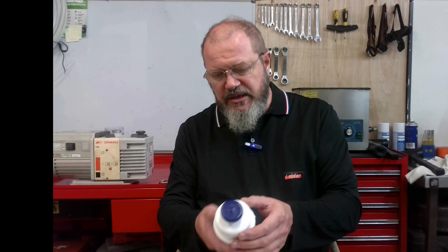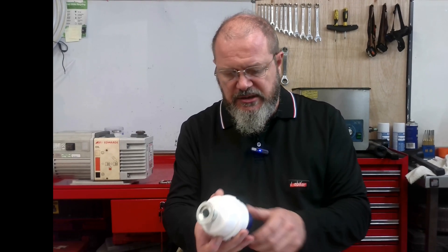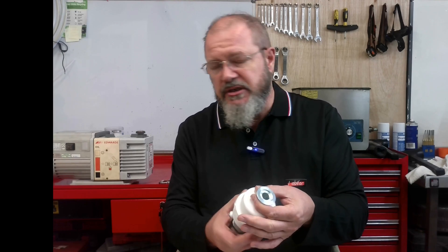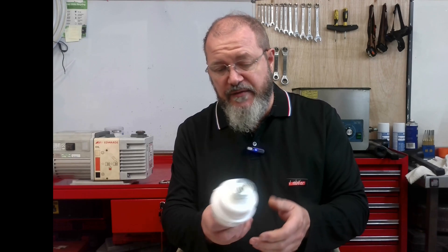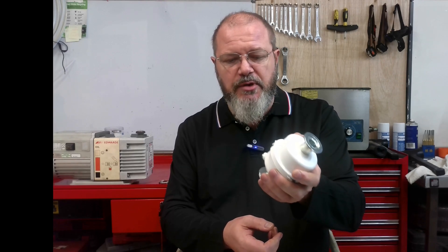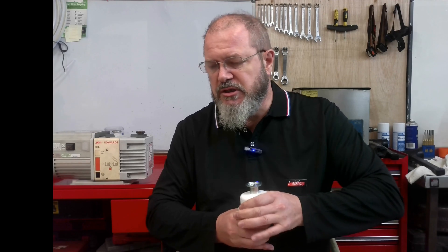The way it's dealt with is using a coalescing filter fitted to the exhaust — and that's what we call an oil mist filter. This is our OMF 25 oil mist filter. It has been sized to suit a number of small pumps from many manufacturers. It has a KF 25 flange top and bottom, and it also has a drain port on the side.